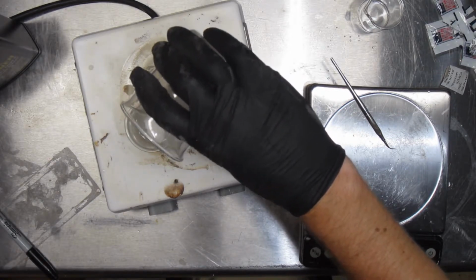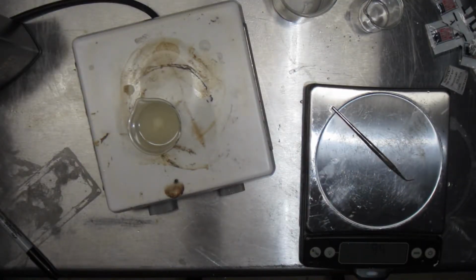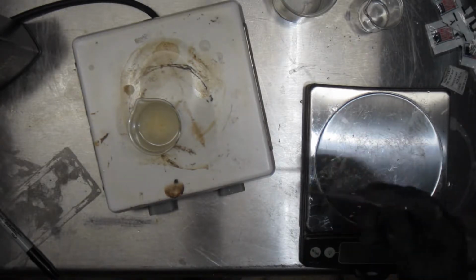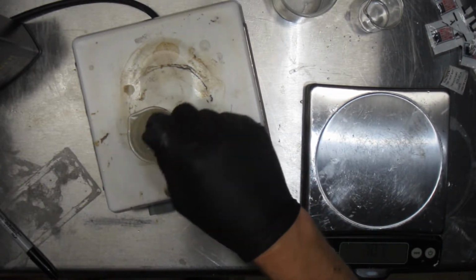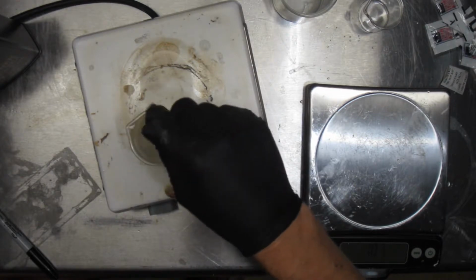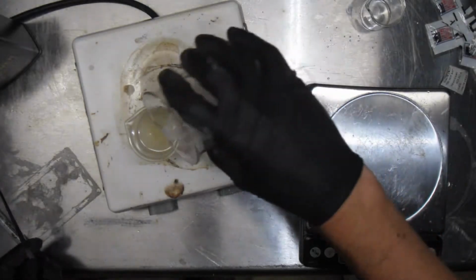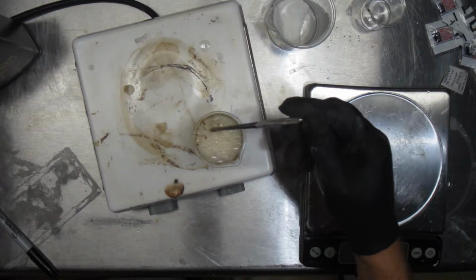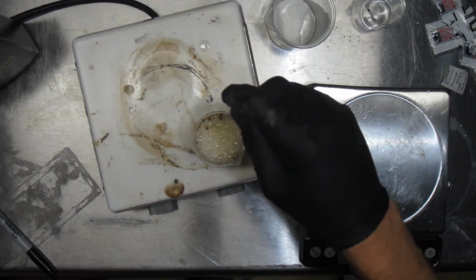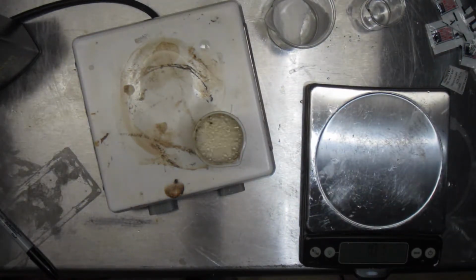Hopefully things don't go too crazy on me. Odd color, wouldn't you say? It's kind of turning brownish. That's probably, oh, you know what it is? It's whatever schmoo was attached to some of those silica gel beads. Some of them were a bit yellowish. Either contaminated or who knows what. Yeah, there is definitely a bit of a scum forming from whatever was in those things.